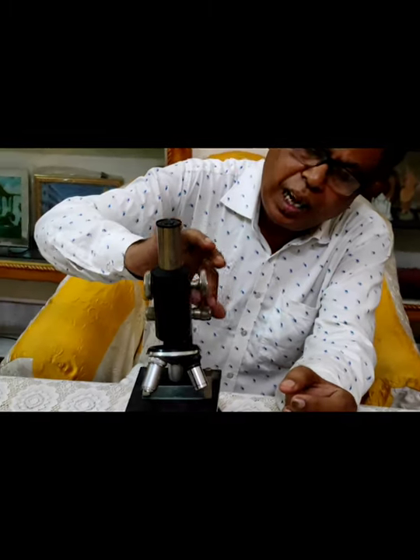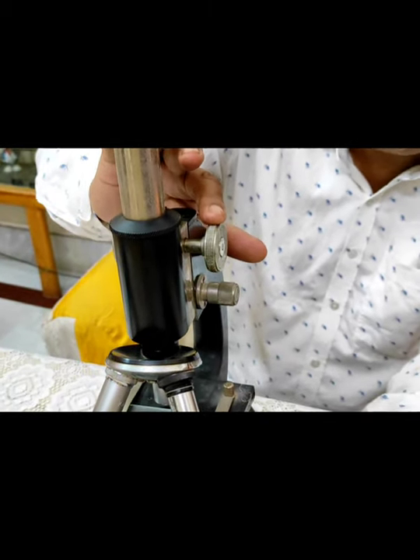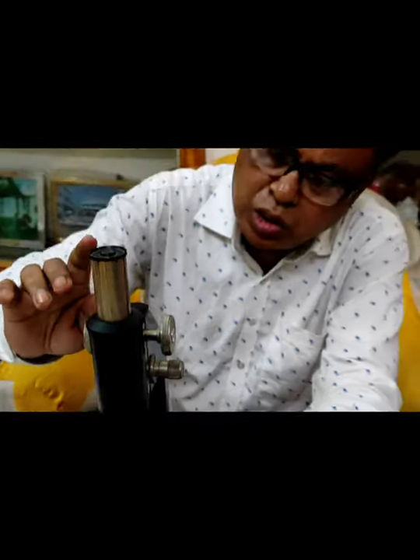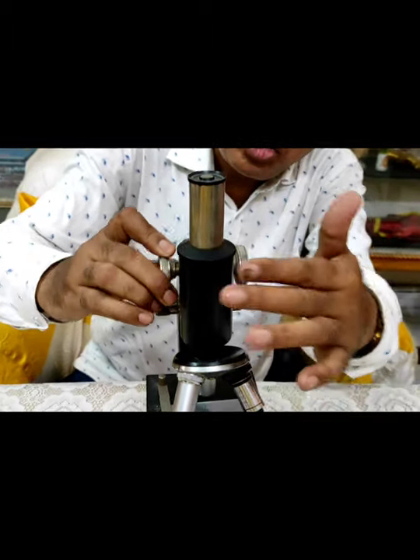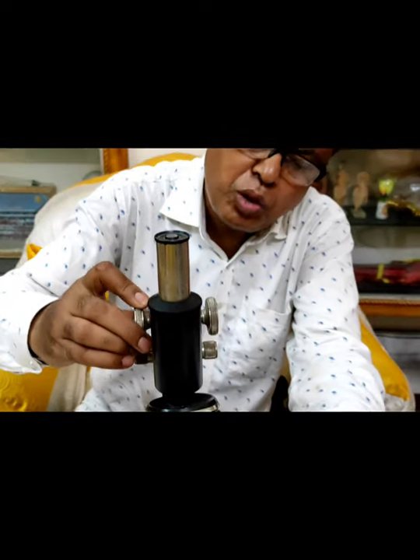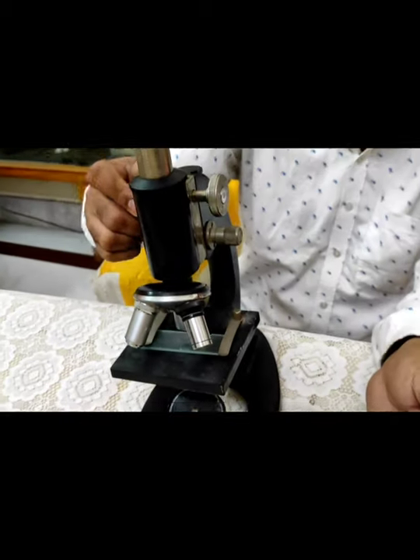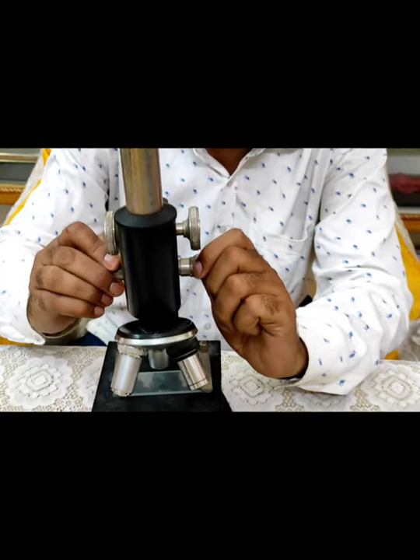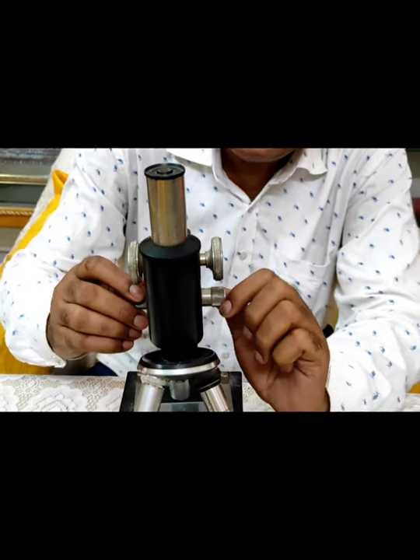You can see the two adjustment screws. One is the coarse adjustment screw and another is the fine adjustment screw. With the coarse adjustment screw, you can move the microscope draw tube, eyepiece, and objective, so that the material can be visible under the microscope. And with the help of the fine adjustment screw, you can see that the material is cleared.